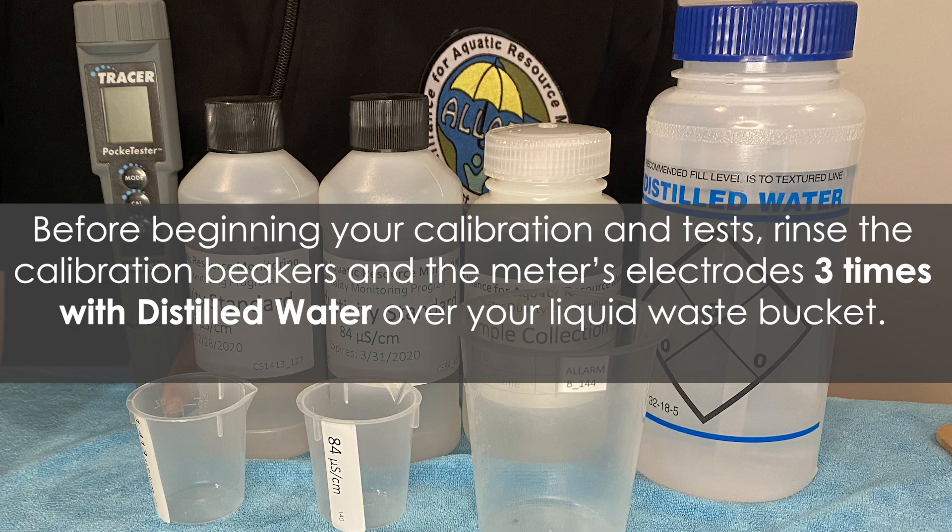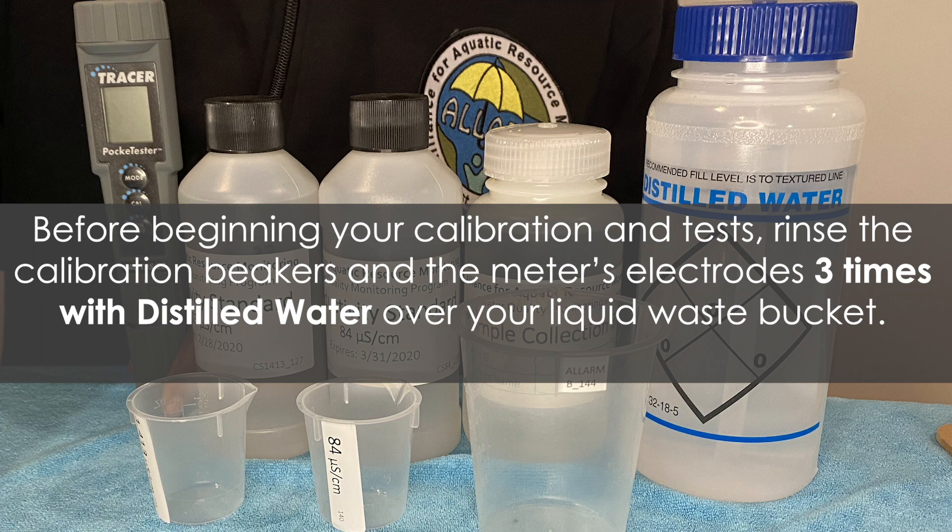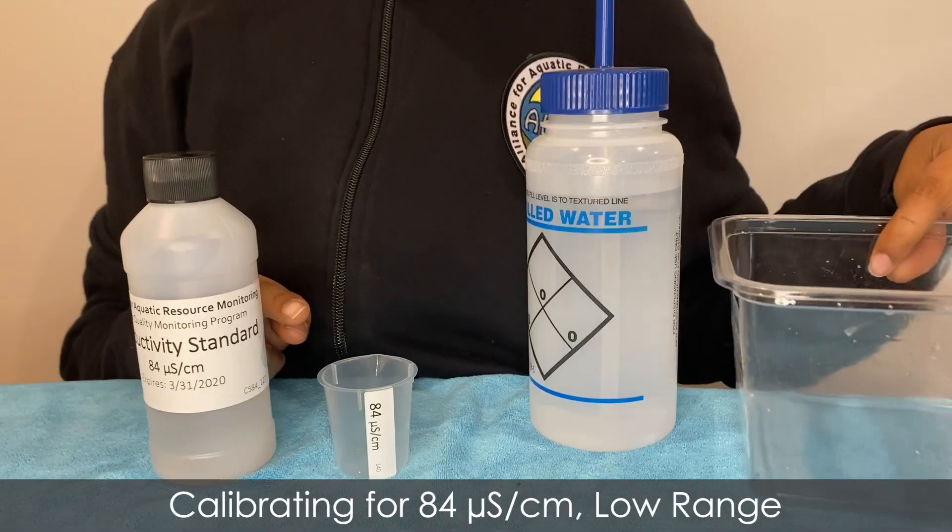Before beginning your calibration and tests, rinse the calibration beakers and the meter's electrodes three times with distilled water over your liquid waste bucket.